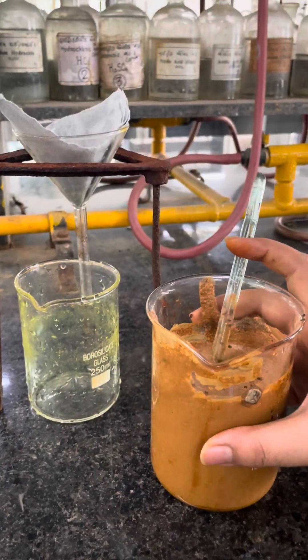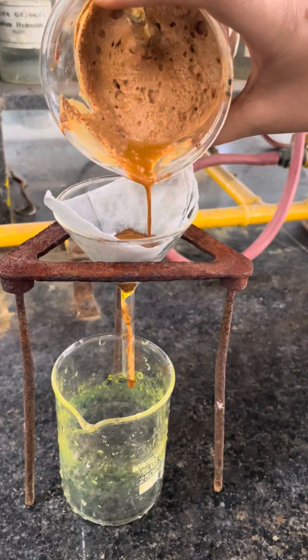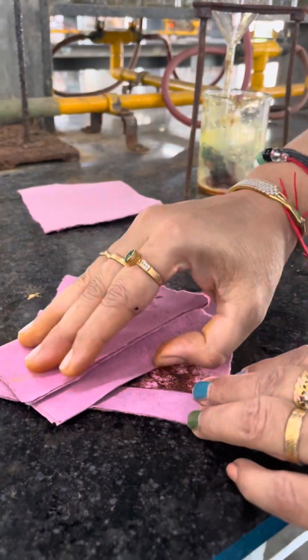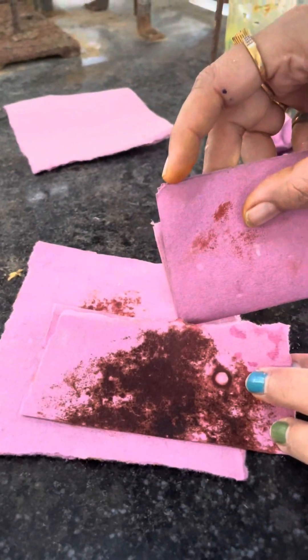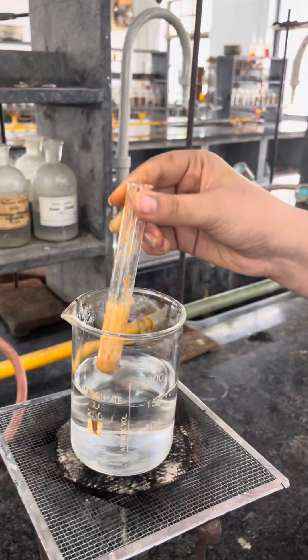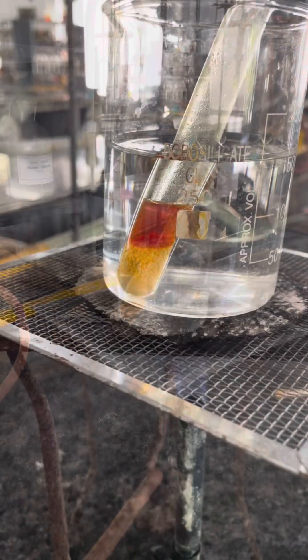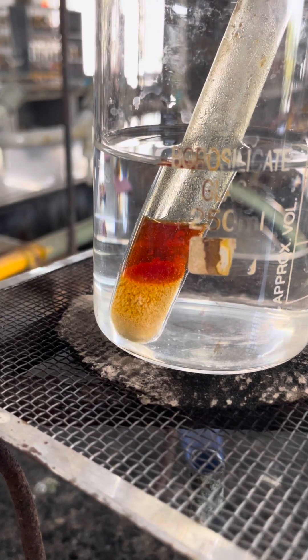Filter the precipitate and dry it with blotting paper. Recrystallize the product from ethanol. The yield of para-iodonitrobenzene is about 7.2g and the melting point is 170 degrees Celsius.